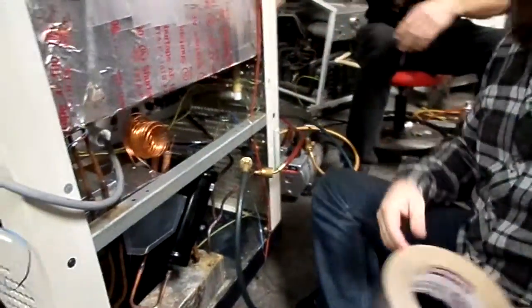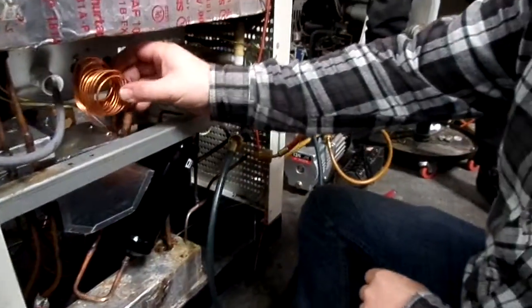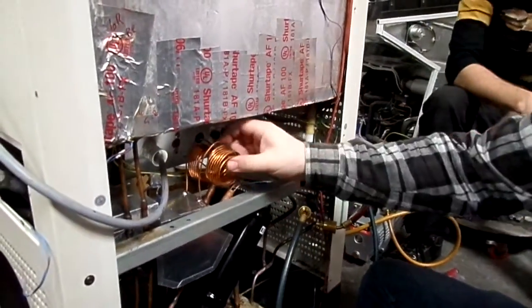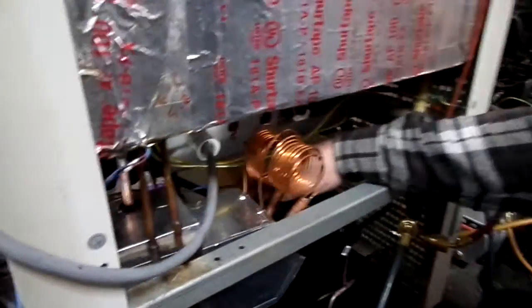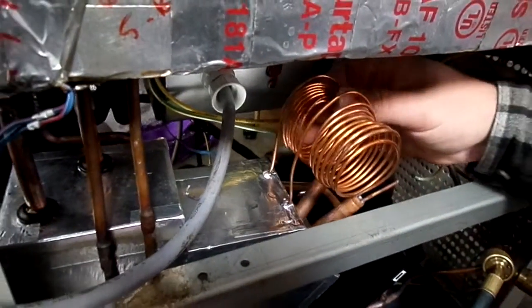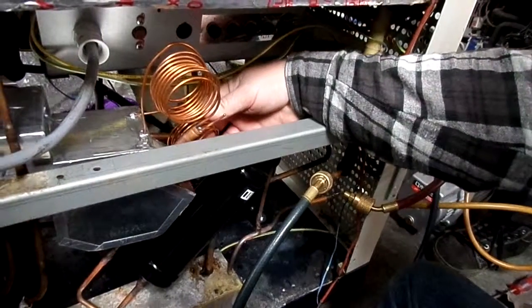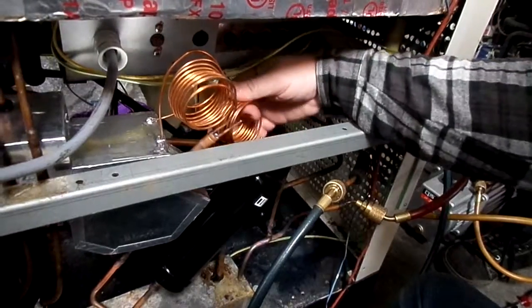Alright. So to button this guy up, first thing we gotta do is place our bulbs for our expansion valves. Now if you recall, the front expansion valve bulb goes on the left side return. So it'll go right in line there. And then the one on the rear goes to the right side return. So copper bends. Be nice to it. It's going to have to bend flat because it's got to go underneath our electrical panel there.